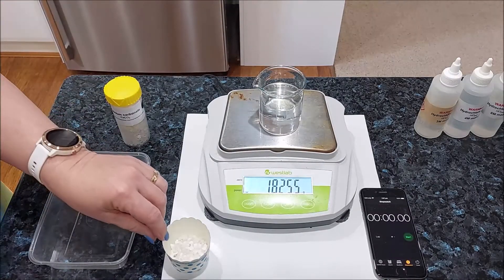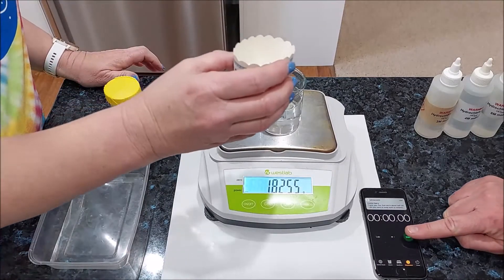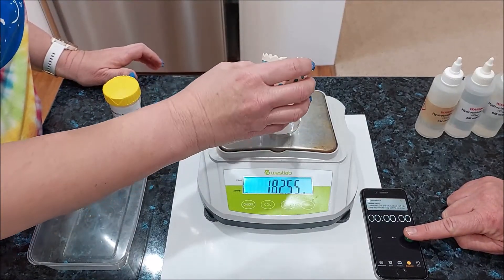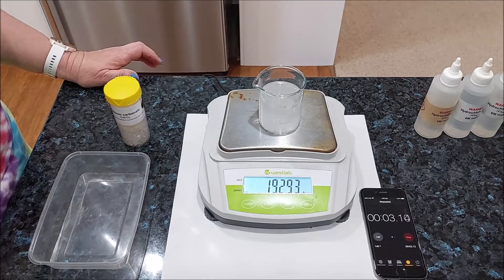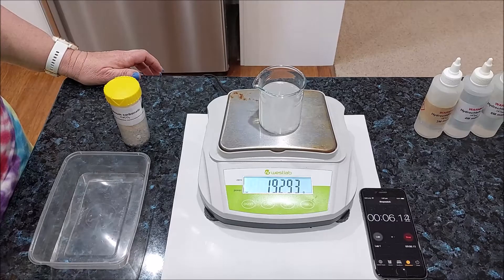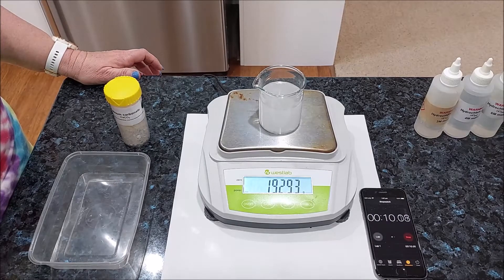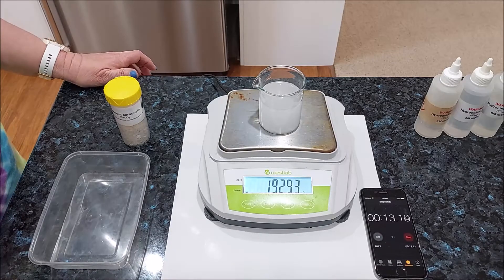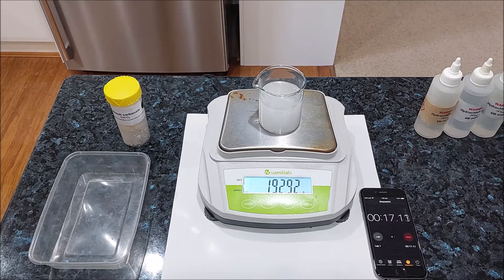So there's your starting mass — remember to add the mass of the marble chips. And here we go, ready, set, go. I want you to record the mass at the one minute mark and at the two minute mark.